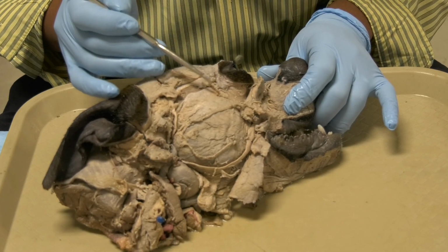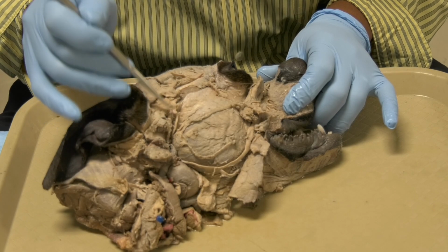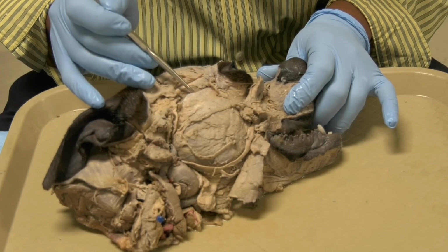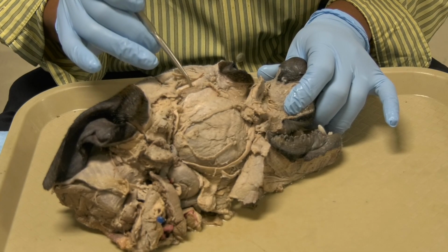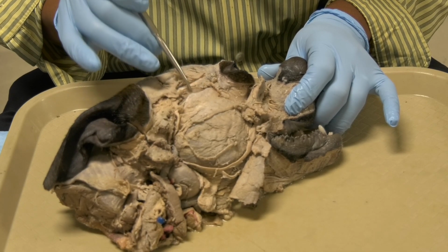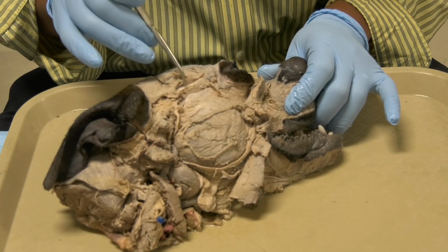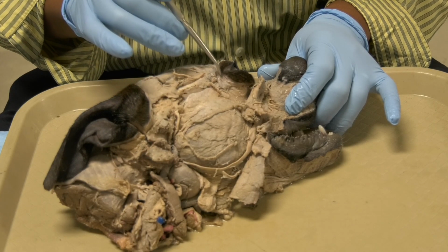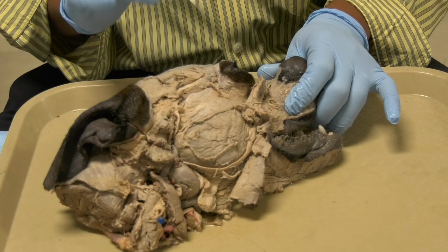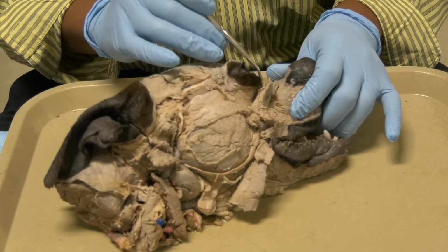Okay. And the auriculopalpebral nerve, after it gives the auricular branch, you can block the palpebral branch at the dorsal aspect of the zygomatic arch. You can block it at that level here, okay, to give you a chance to examine the eye, because that will prevent the animal from shutting their eyes.